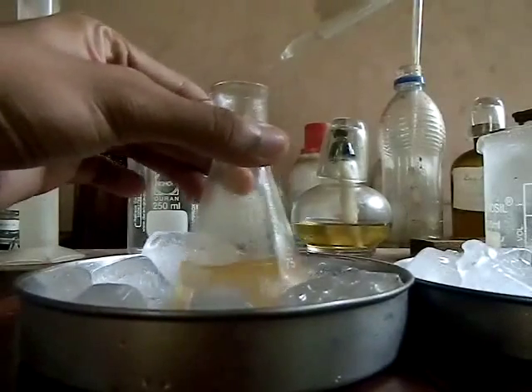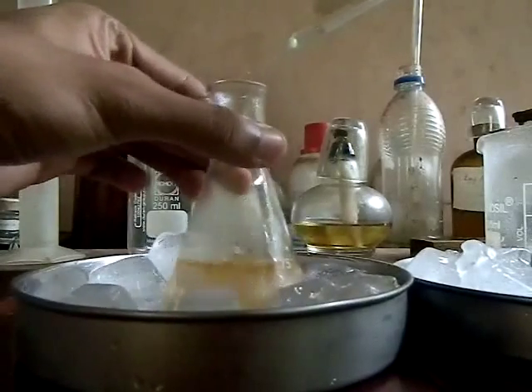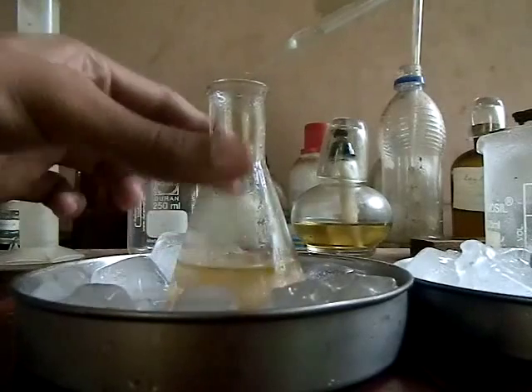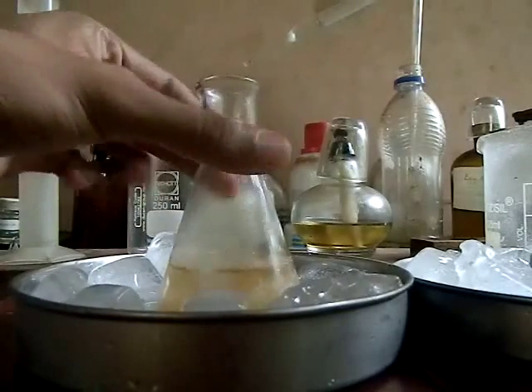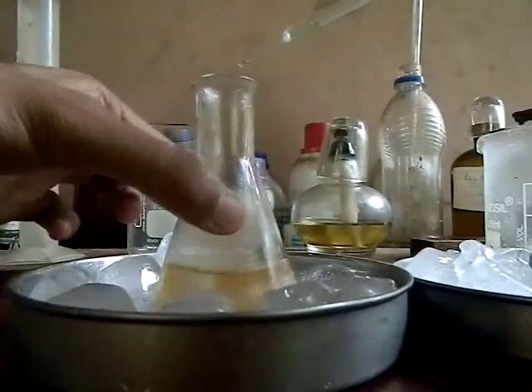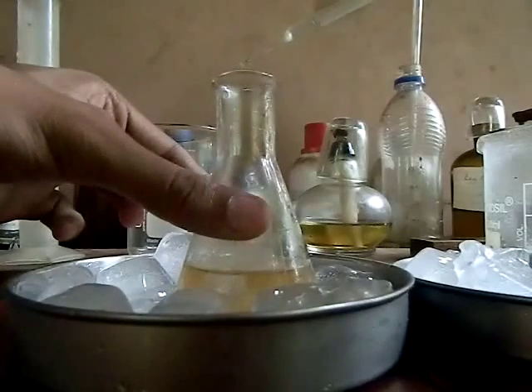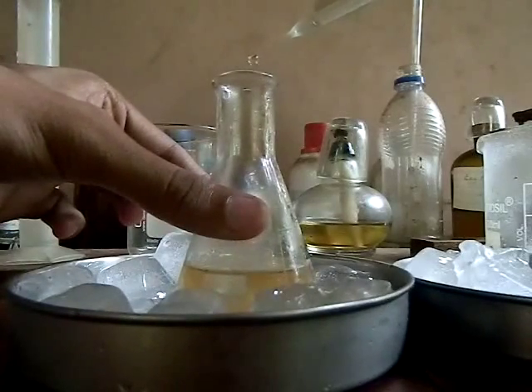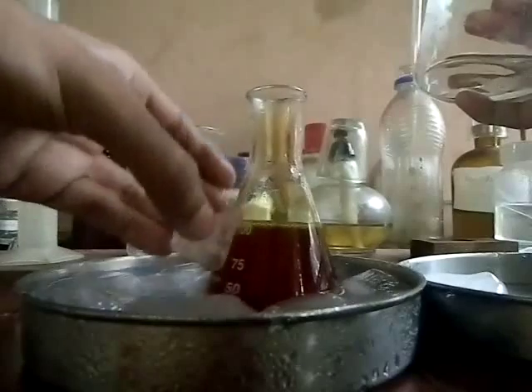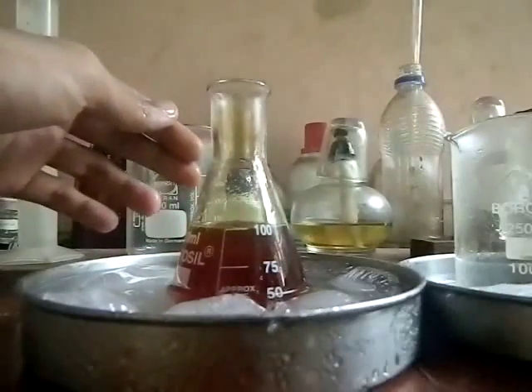We pour the 30 ml of sodium nitrite solution into the aniline hydrochloric acid mixture. This reaction has to be done very slowly so that no fumes of nitrogen dioxide are evolved and the reaction proceeds smoothly. We add it drop by drop, shaking with each drop — this takes time.